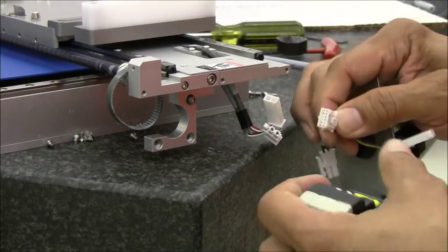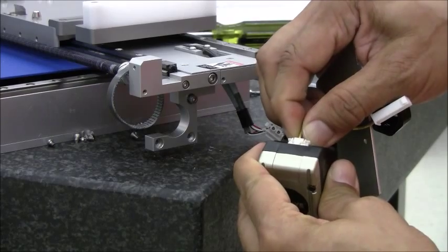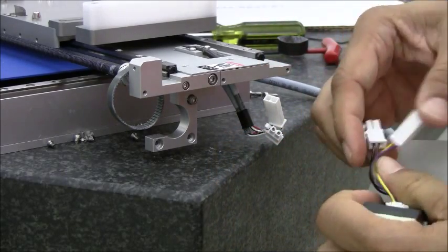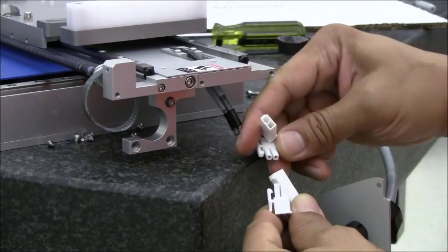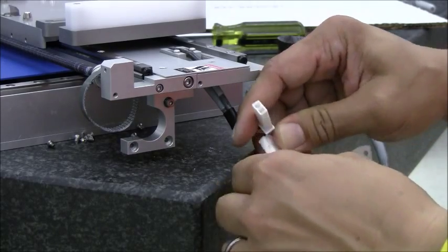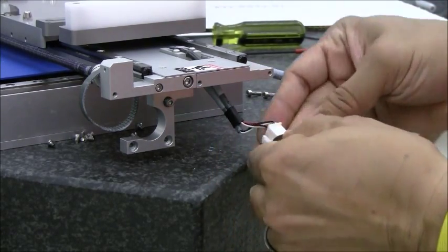Installing the replacement motor — make sure that you firmly connect into the motor and that it clicks in. The sensor connections are pretty much self-explanatory the way they go in. Connect those in and fasten them with the supplied Velcro.